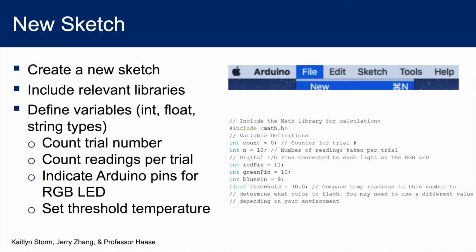There are several types of variables, and the most common are int for integers, float for numbers with decimals, and string for text. Since we are taking multiple trials and each trial has 10 readings, let's make 2 integer variables to keep track. Since we are using an RGB LED capable of changing color, we need to indicate which Arduino pins we will connect to the red, green, and blue pins. In our case, we will specify pins 9 through 11. Finally, we need to set a threshold that we will compare our mean to. Let's make this a float, so this variable can have decimals like 30.0.